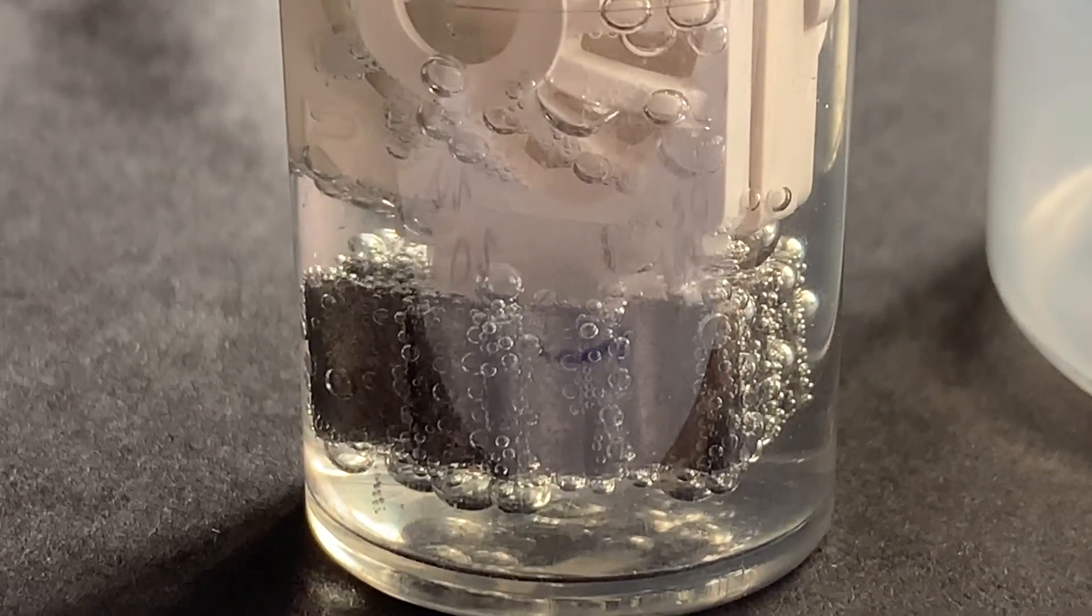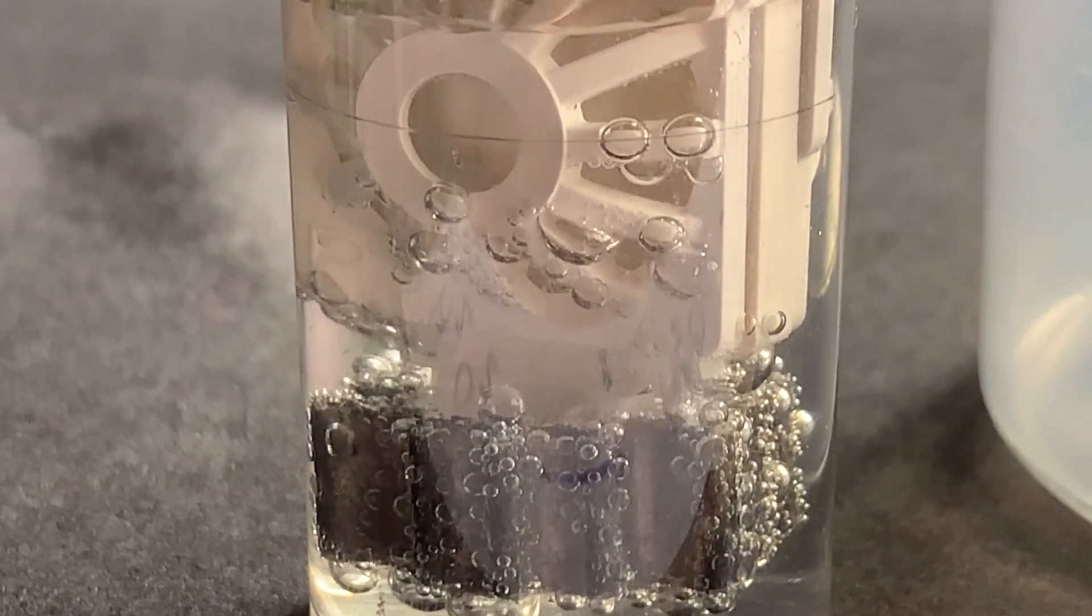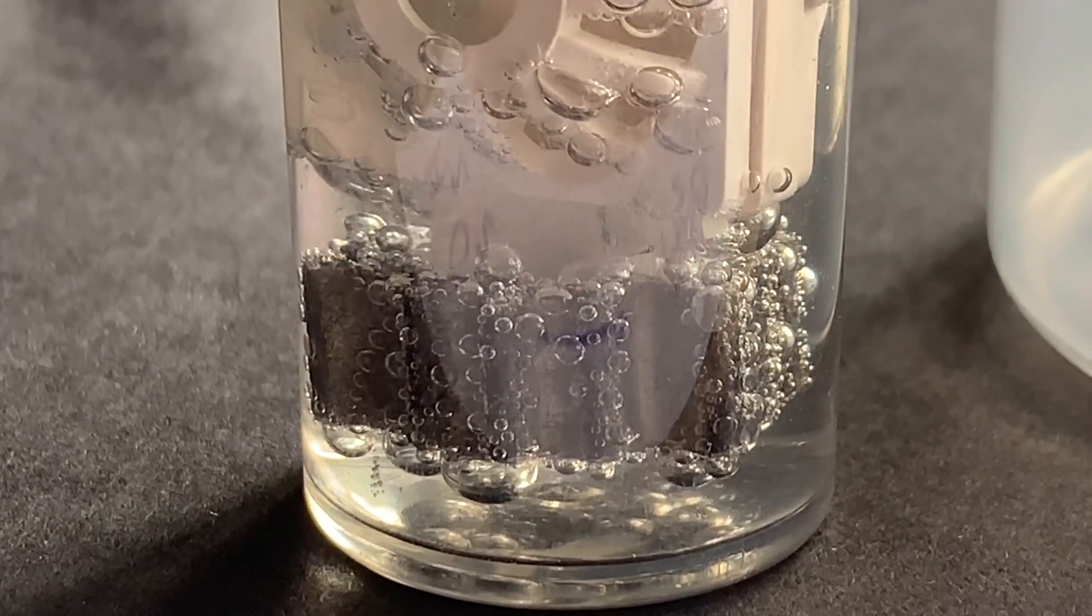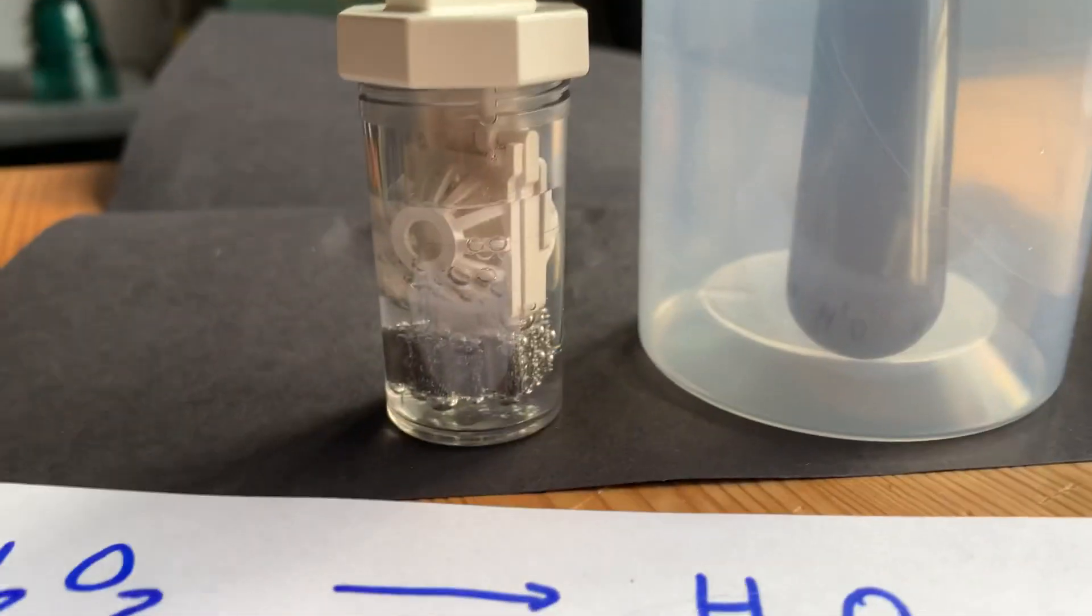Let's check in on our contact lens metal. Oh yeah, look at the bubbles. They're certainly forming and rising a little faster than they had been. Probably just needed some time to build up the size of bubble that is required to float out of the solution.